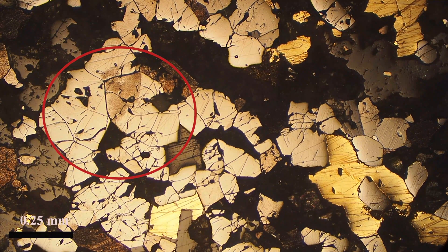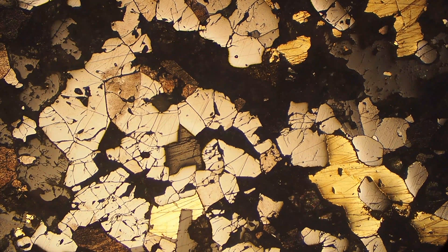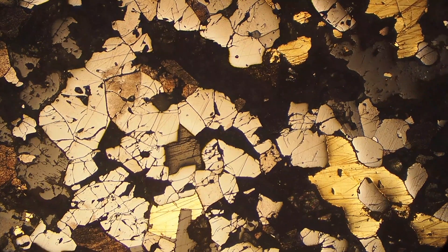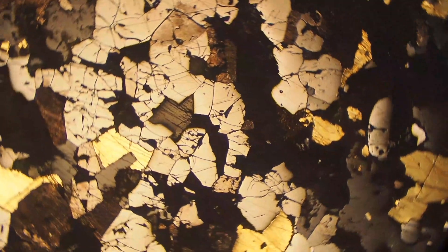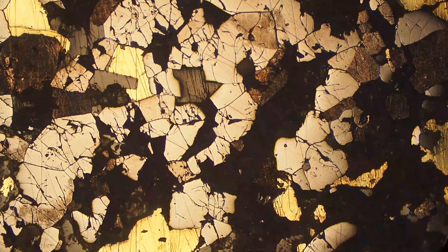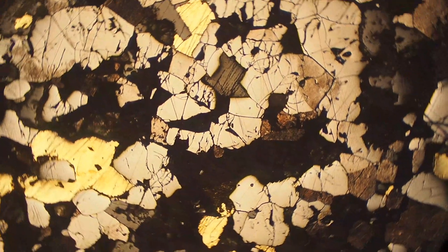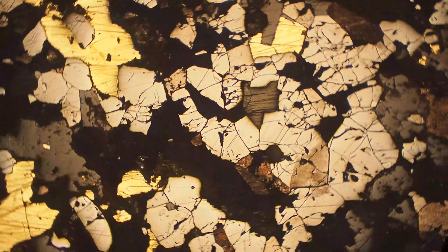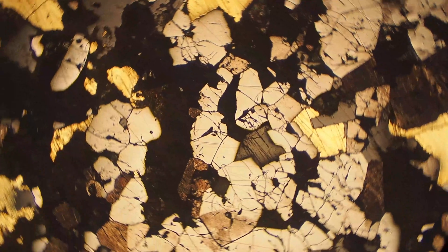Here's our third sample — a cluster of magnetites. Again, it's hard so it's in quite high relief, and it has that kind of gray, sometimes slightly browner color. Again, it's not bireflectant.